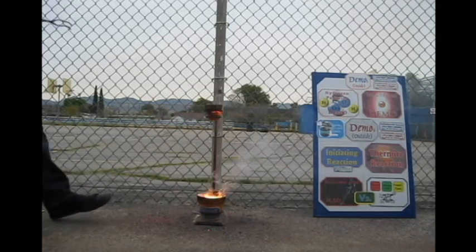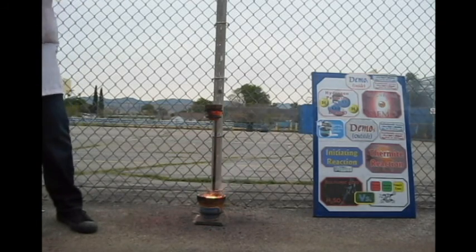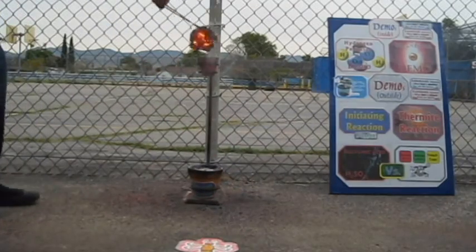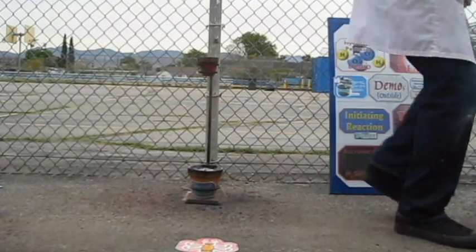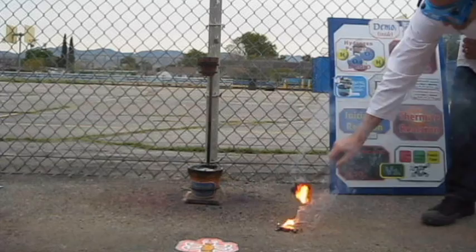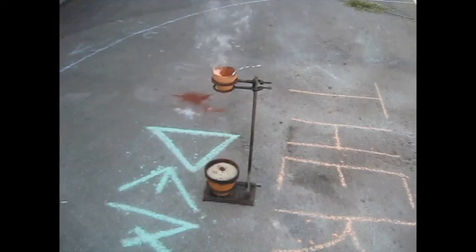Wow. Okay, now, Mr. Pemble is going to do this. Again, watch your feet. Mr. Pemble is going to try to pick up all that thermite. And watch this. Oh, this has got to be on camera. Can I get some to spill out? Oh, it's already solidified. Usually I can get some to pour out on the bottom.